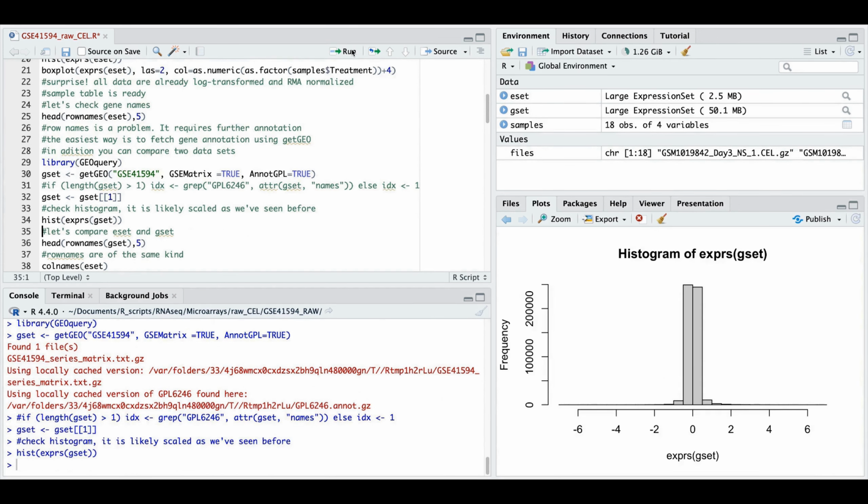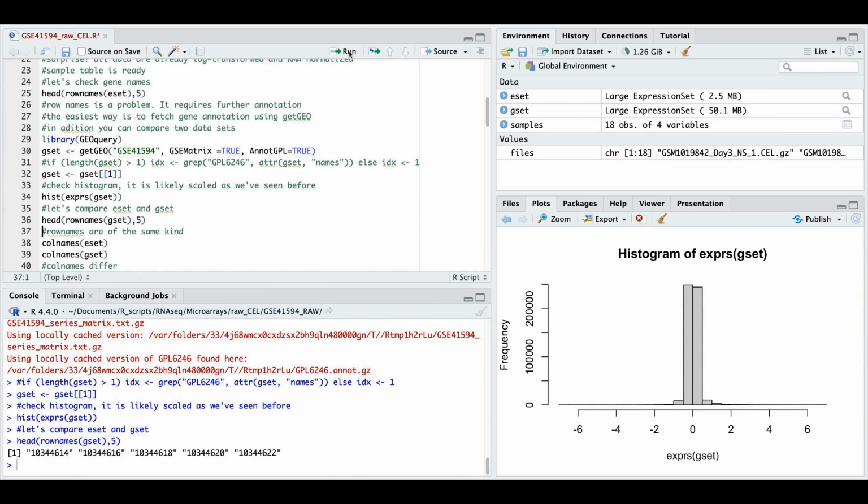Then again we check, did we import it right? Yes, it is a scaled data. What are the row names here? The same. The annotation is now more diverse and includes real gene names.